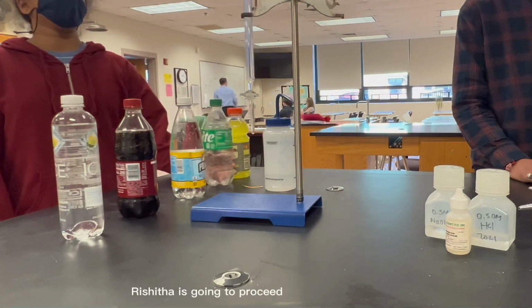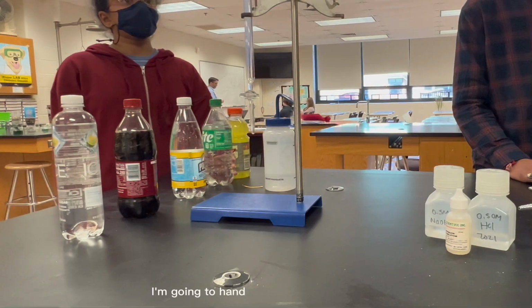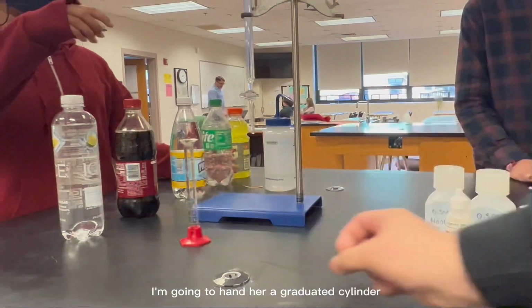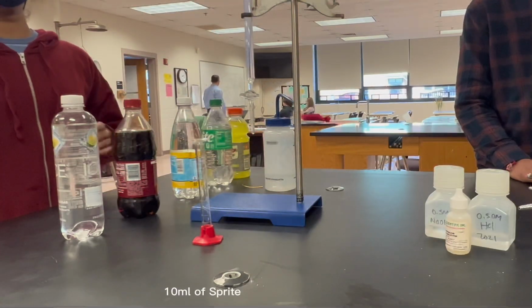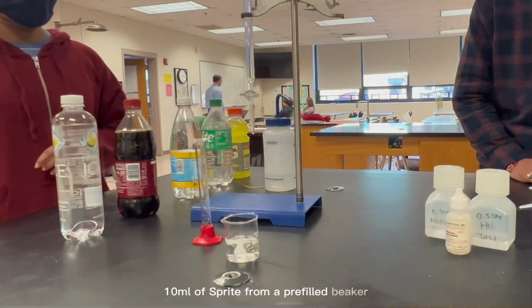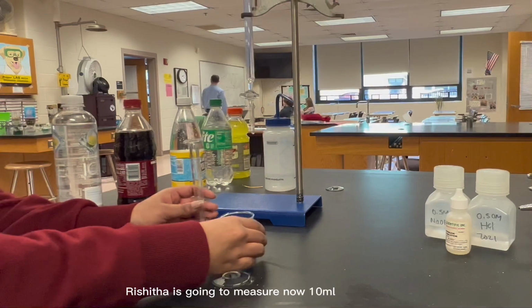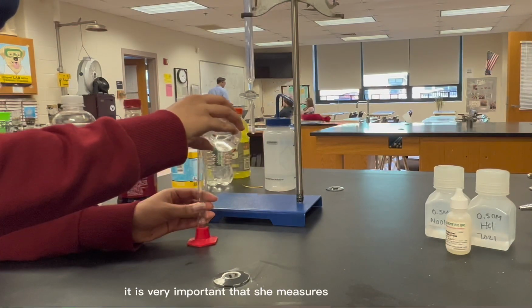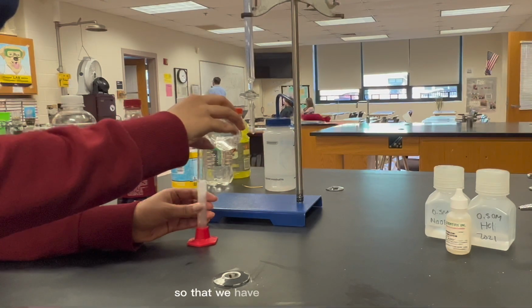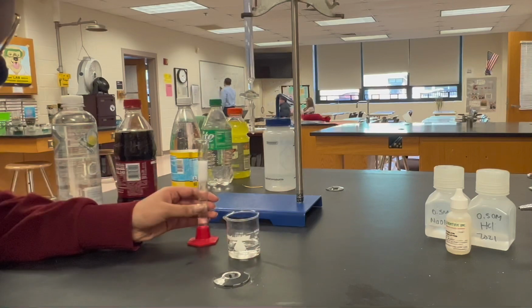Rishitha is going to proceed with the first titration, the titration of Sprite. I'm going to hand her a graduated cylinder that she's going to use to measure an exact 10 milliliters of Sprite from a pre-filled beaker. Rishitha is going to measure now 10 milliliters of the Sprite. It is very important that she measures an exact 10 milliliters so that we have accurate volumes throughout all of the solutions.